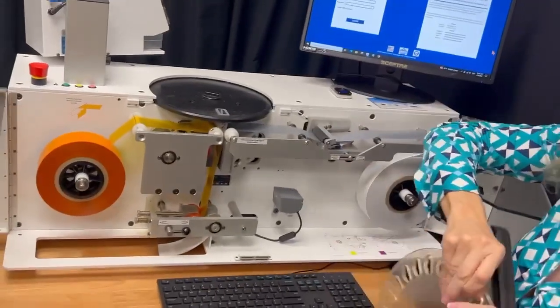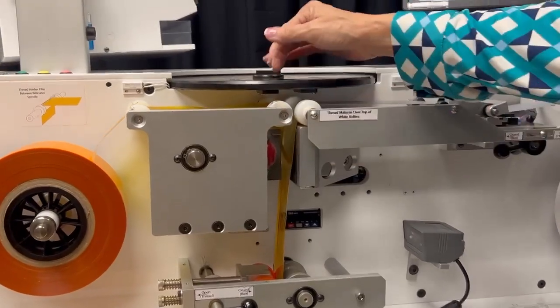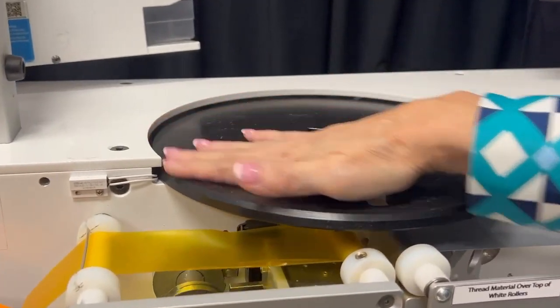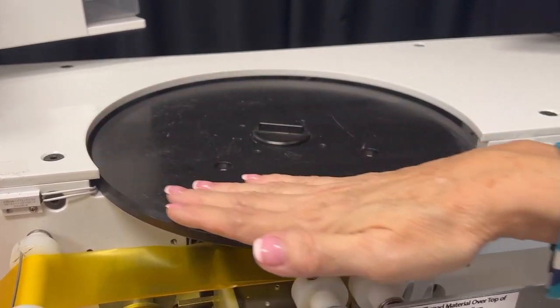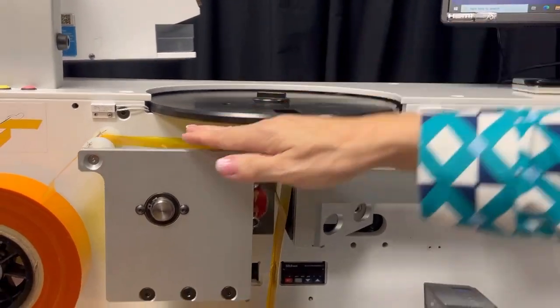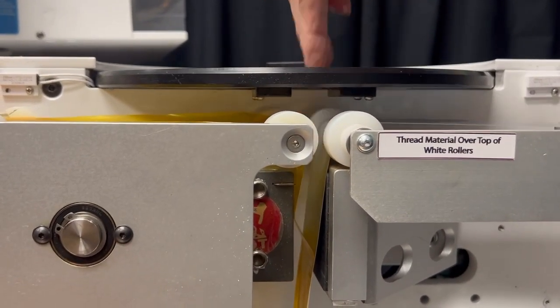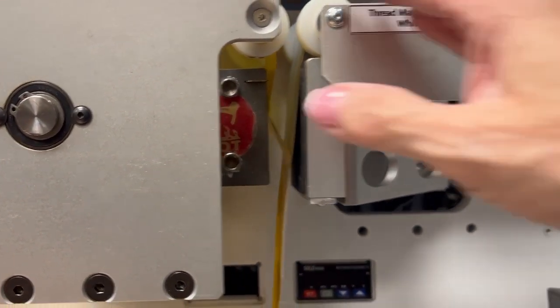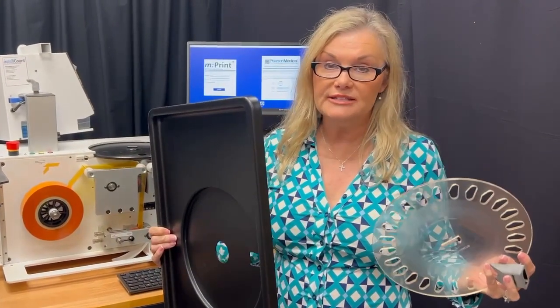You can easily take all of these parts off, and you can see how easy it is to put your hands through here to do the cleaning. The pill will not be touching any of this, but if you were to get some kind of incidental powder or residue from a pill, you can easily clean this off. We recommend 70% alcohol for cleaning. Here is the path that the pill will drop through — this chute right here — so it will drop directly into the paper. There should not be any type of cross-contamination whatsoever.